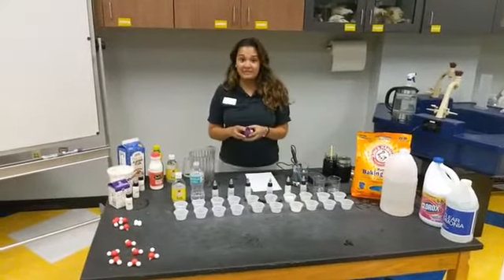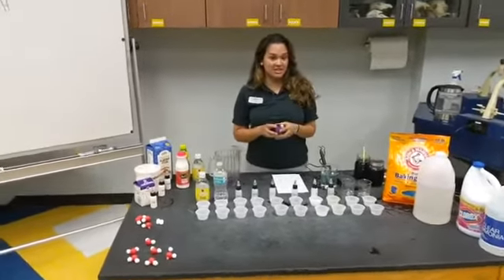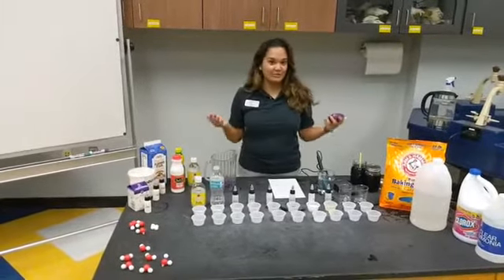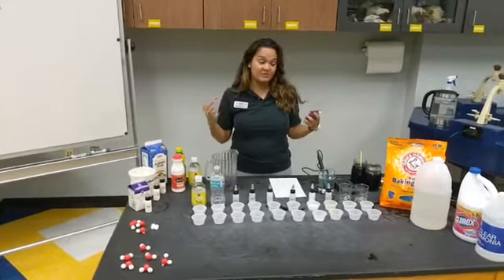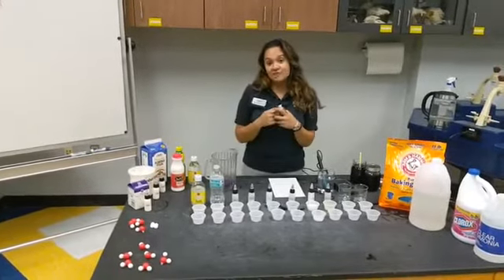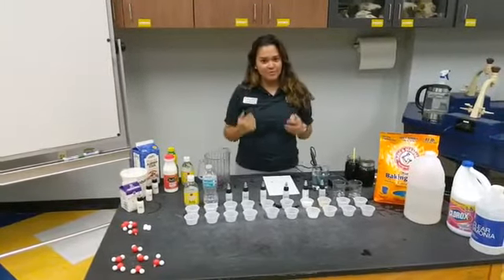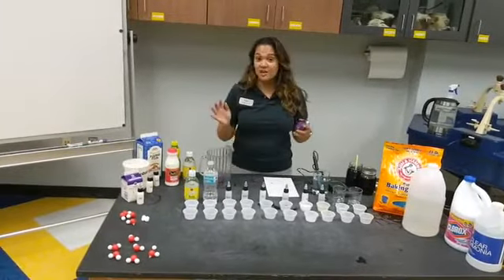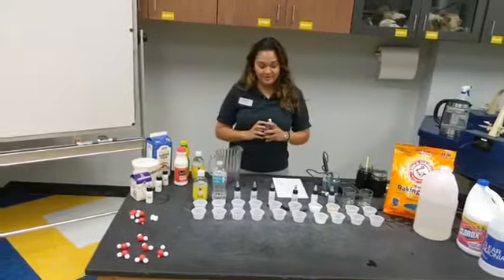Today we're in our STEAM lab and we are learning all about acids, bases, and pH. You can see I have a lot of stuff here and we're gonna go through that a little by little as we use it. If you try to do this experiment at home, and you definitely can, you can use almost anything that you can find in your kitchen, your garden, your bathroom, your makeup counter, many different places. So you have a lot of options to try this at home, or you can just watch with me here. It'll be a lot of fun.